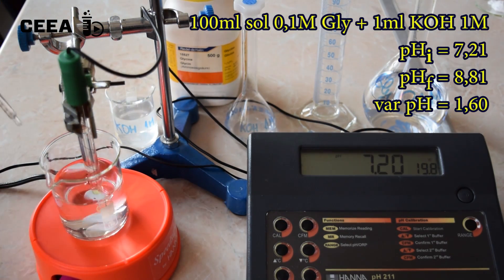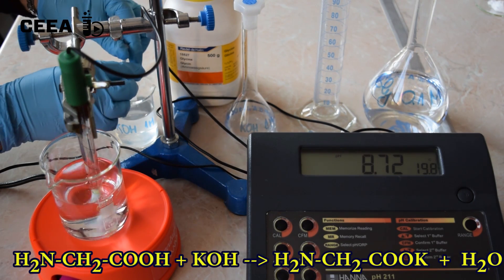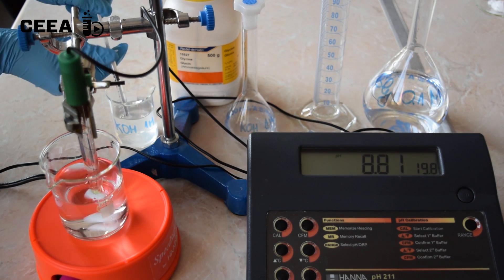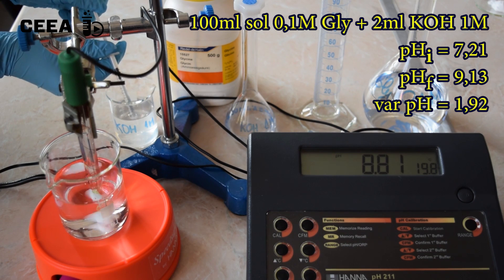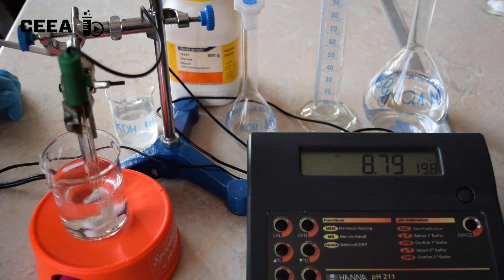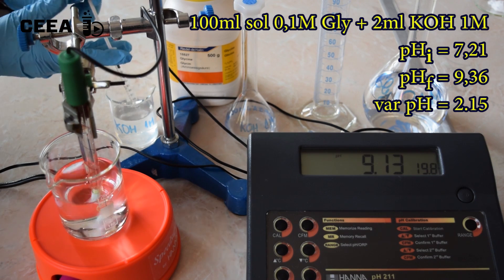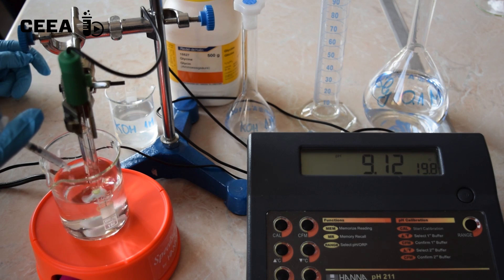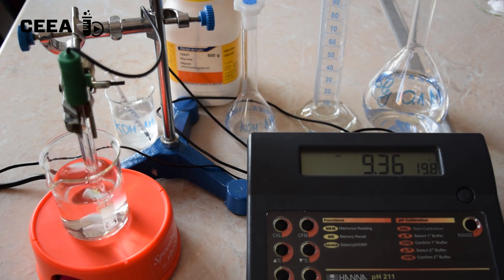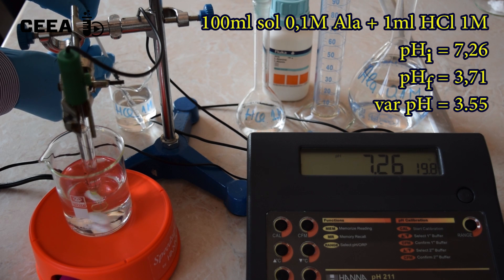Do the same operations with another glycine sample and one molar potassium hydroxide. Repeat the entire procedure with alanine.